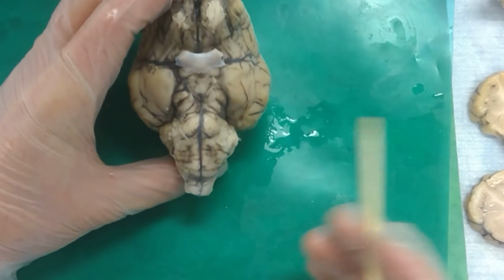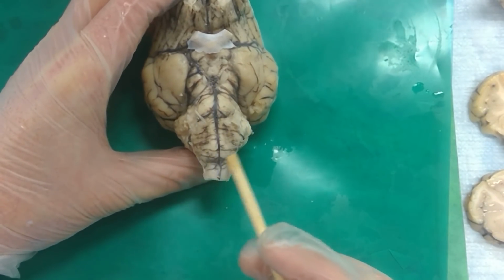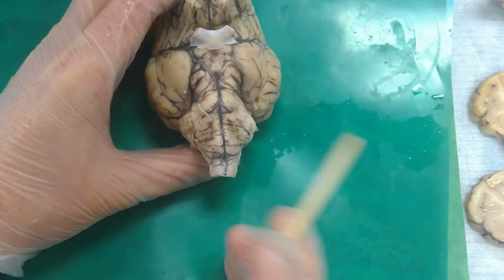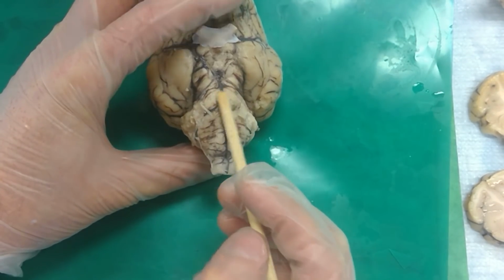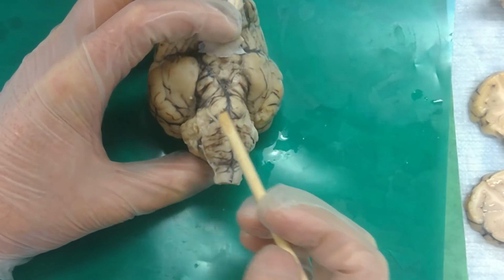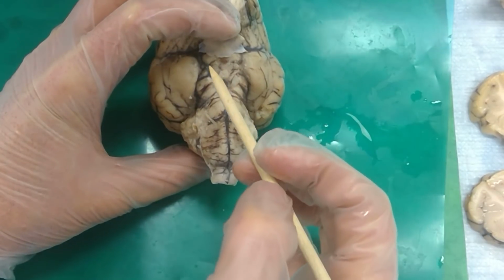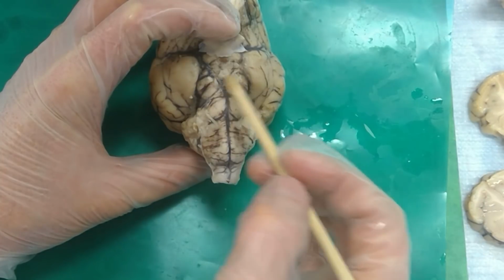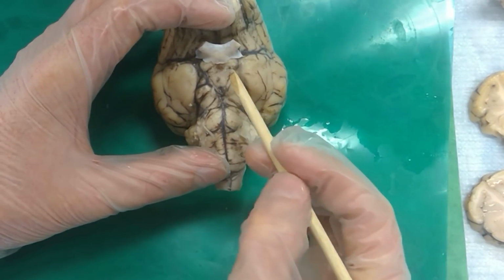Medulla. Right. And so what encephalon is this? Myelencephalon. Right. So if we ask you what encephalon the abducens are on, then that's the myelencephalon, right? And then when we add the pons and this guy, which encephalon is this? Metencephalon. Because it goes in alphabetical order. So you have my, then met, and then the cerebral peduncles are in the? Mesencephalon. Right. And then the mammillary bodies are in which encephalon?